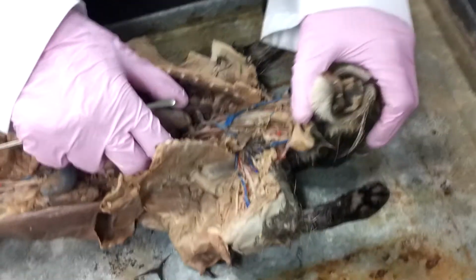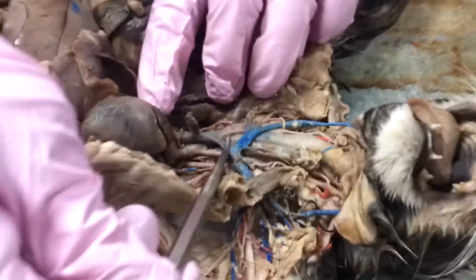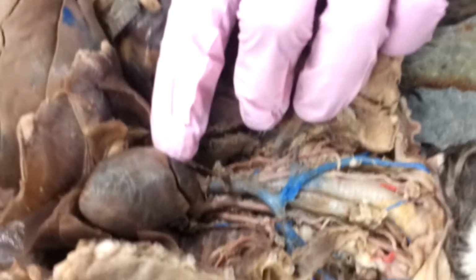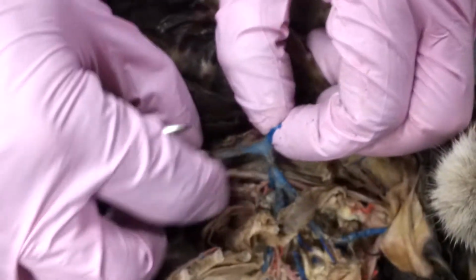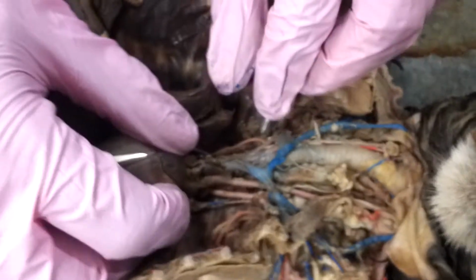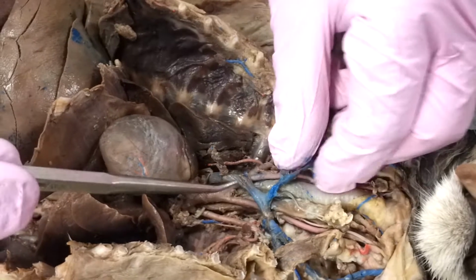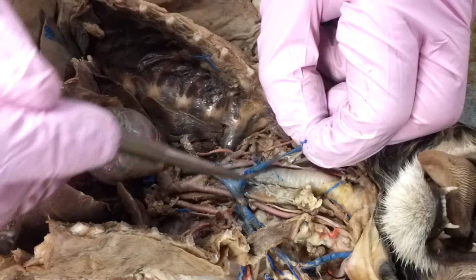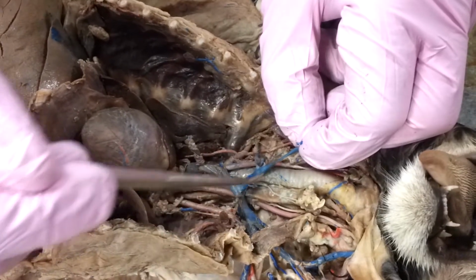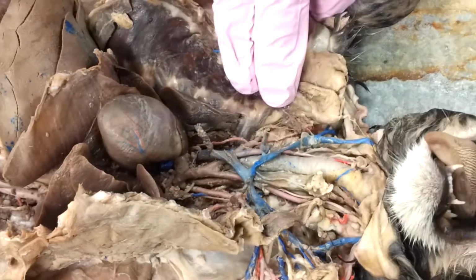And when we're doing the veins, the first thing we want to take a look for is the superior vena cava. Our superior vena cava is going right into that heart. Next, we've got two brachiocephalics, real nice and clear again on this picture. There's our brachiocephalic branch here and our brachiocephalic branch here. So we've got brachiocephalic vein, superior vena cava.